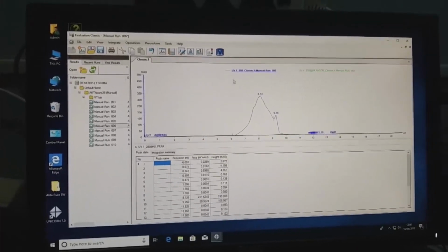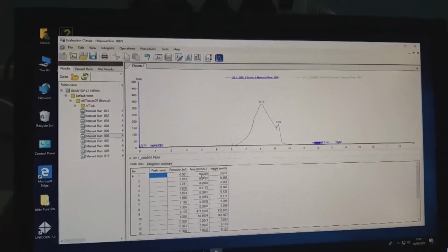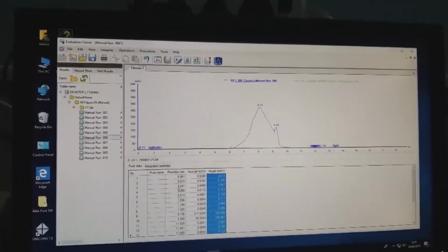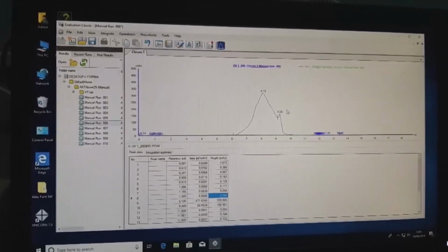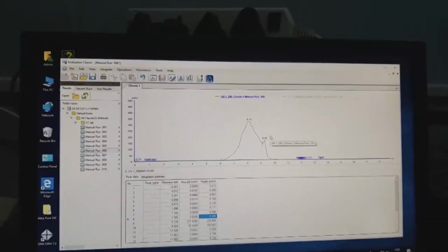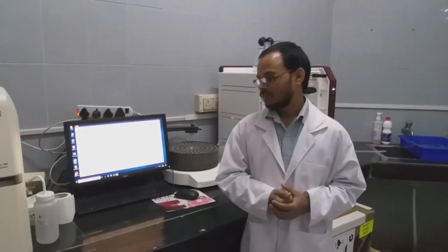As we can see, it gave the retention volumes of the peaks and also the area and height of the peak. These values can be used for constructing a calibration curve. This one belongs to blue dextran and this one is for BSA. So in summary, in this video we showed how to run a gel filtration. We showed manually how to pack the column with the beads, and also connecting it to the instrument. So hope this will help your research, to improve your research.